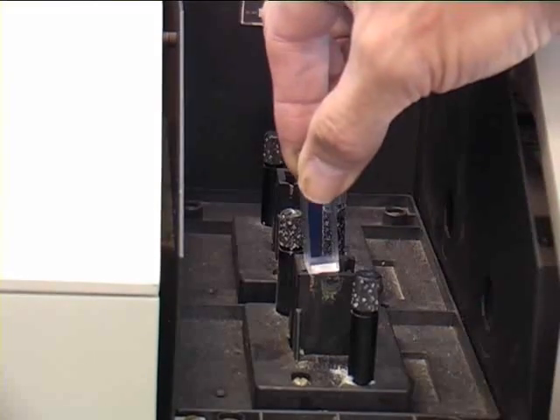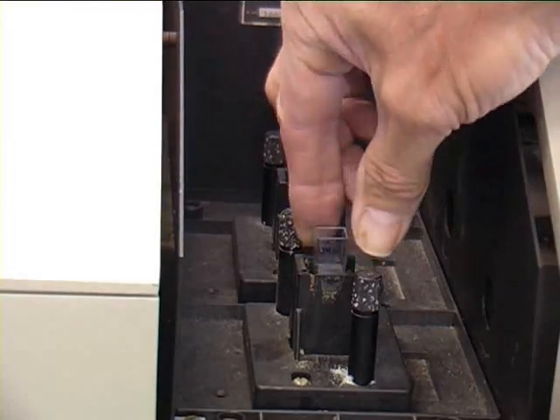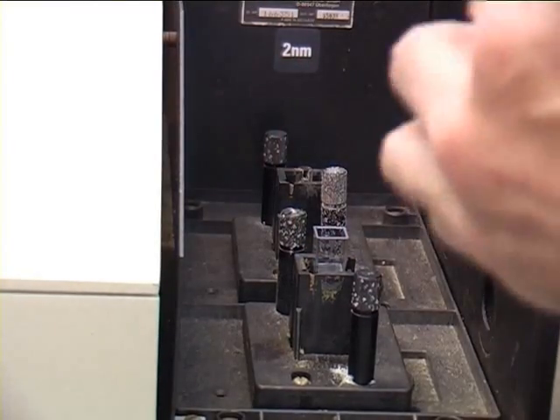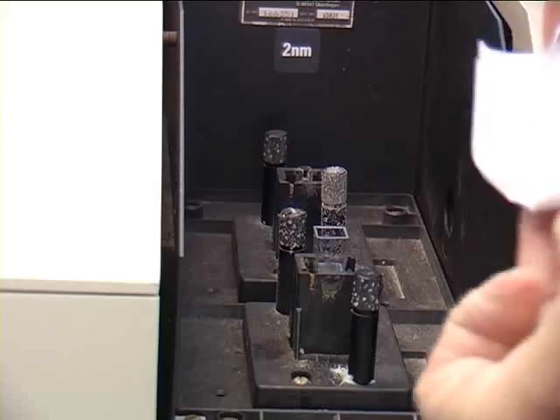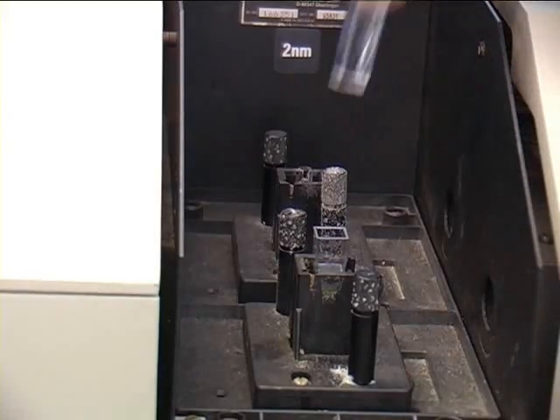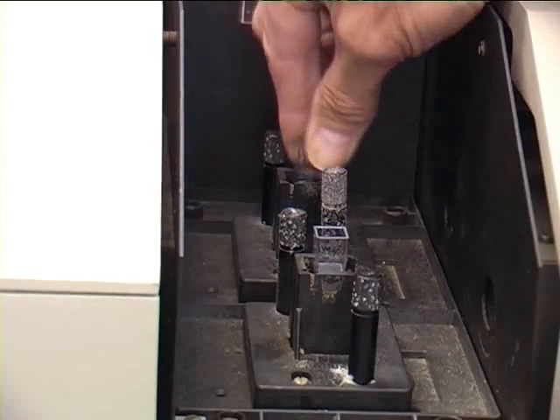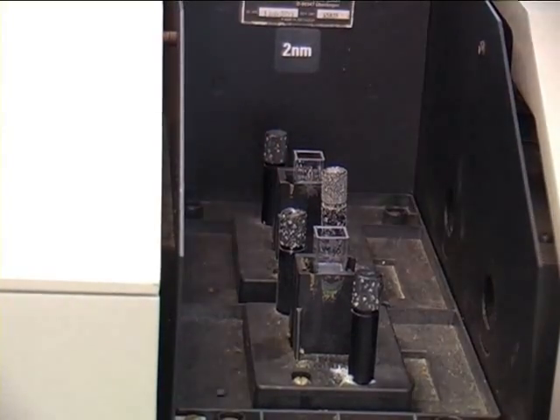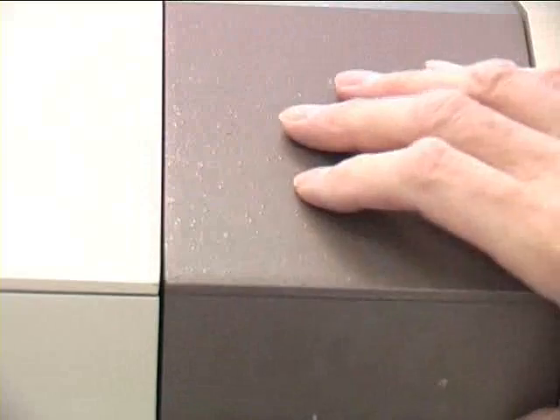Some cuvettes will have dimples on, that will be the side you handle. The cuvettes are then placed inside the spectrometer and the lid closed.